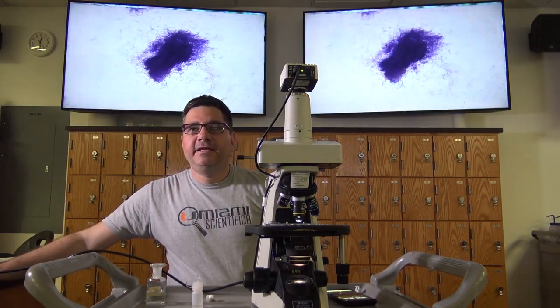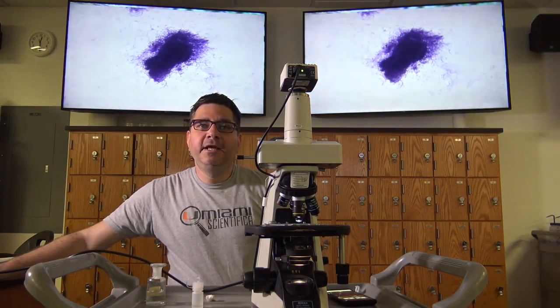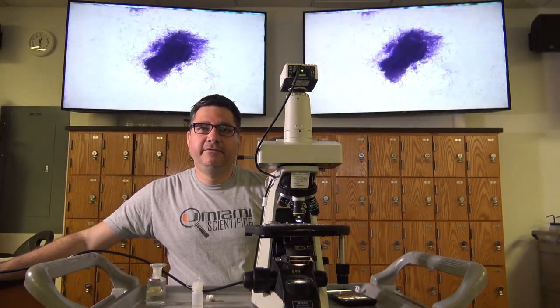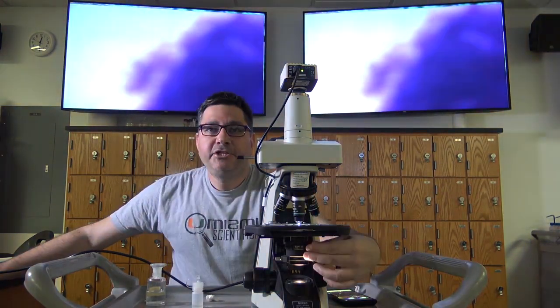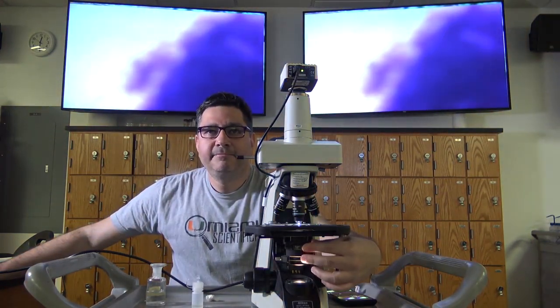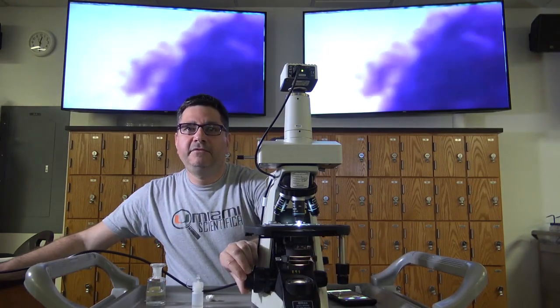Once again, after getting the specimen into focus, increase magnification. Using the turret, dial the scope to the 40x objective, which is called the high-dry objective. Adjust the tab of the diaphragm to the 40x position. Fine focus to view the specimen.